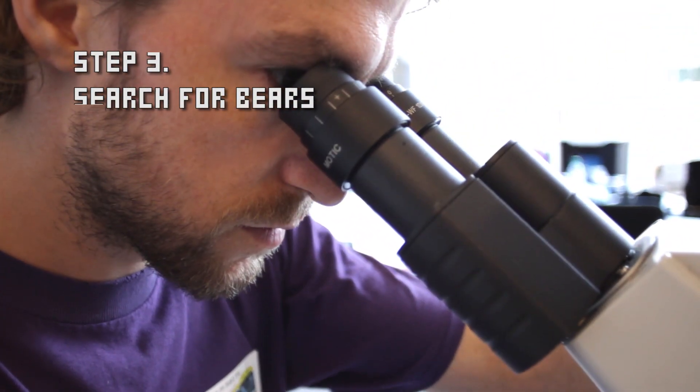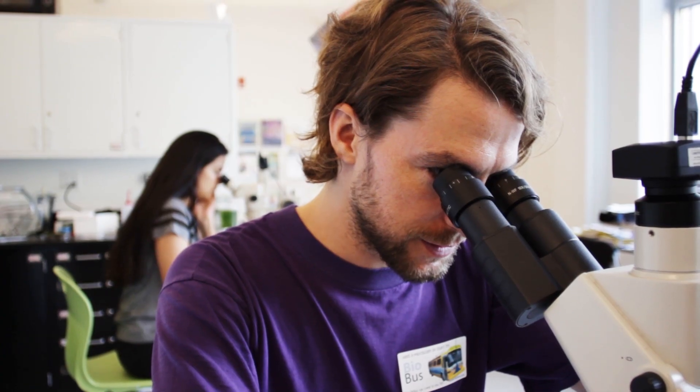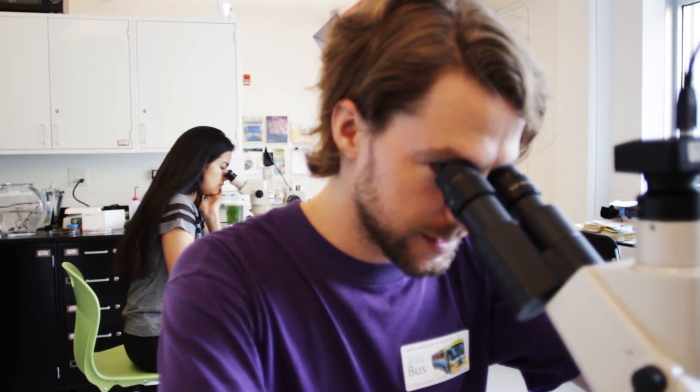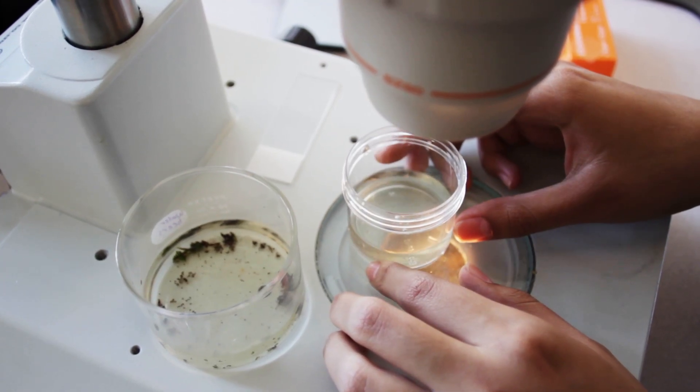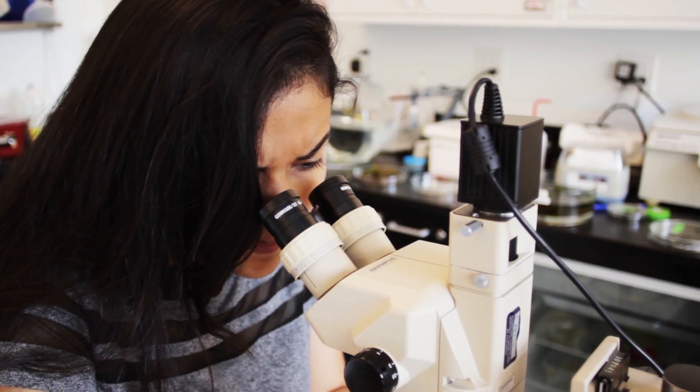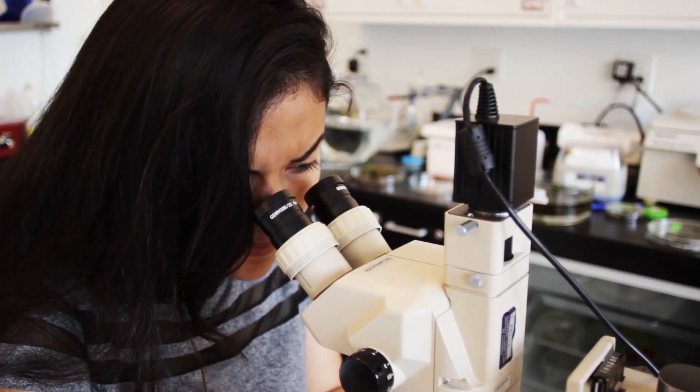What do you see Dr. Ben? Oh well, that's a nematode or a small worm. Those are pretty cool too, but we're looking for those water bears. Let's see what Valeria finds. And that eyebrow is saying that she doesn't see a thing.